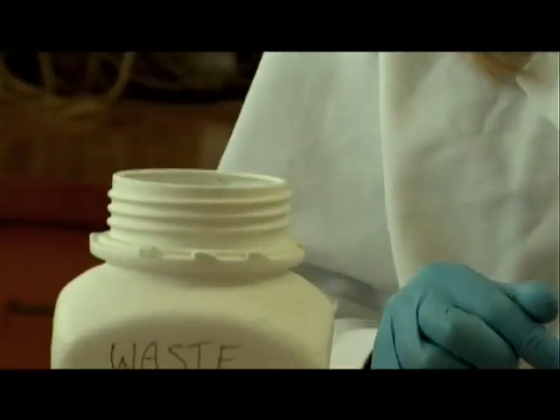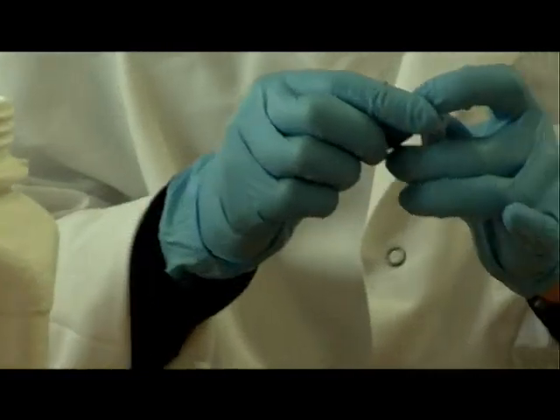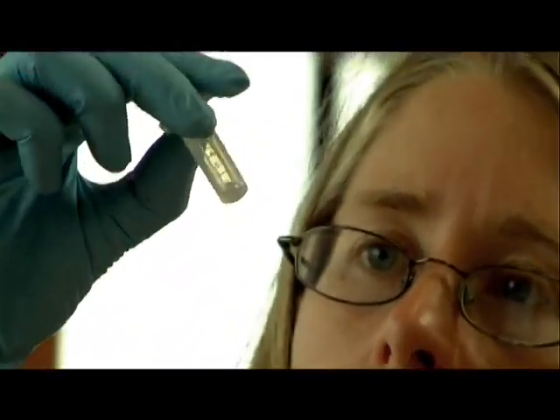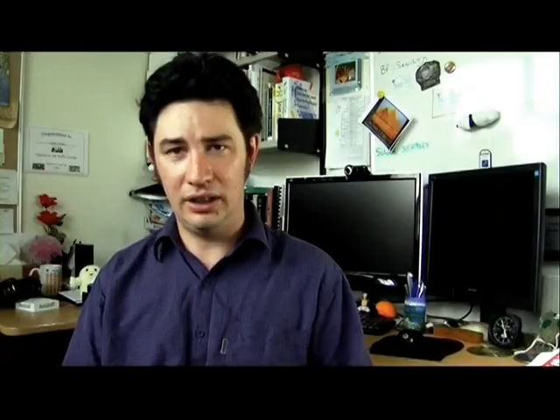Now we have a sample of weka DNA. You can't see it with the naked eye, so we will have to perform gel electrophoresis on a small sample. Then we will be able to assess the quality and quantity of the DNA we have extracted.